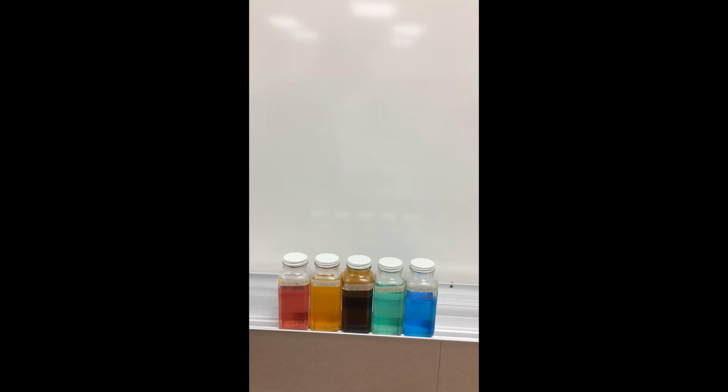We've learned in our course here when ligands, in this case here water, try to surround the central metal ion, they cause all the d shells to go up in energy, splitting into two levels. Because the size of the energy gap corresponds in the visible region here, there's one unique wavelength that gets absorbed. Whatever isn't absorbed here is then transmitted through the solution. Right now here I just have the classroom white light shining on these solutions. We're seeing all the vibrant colors here.